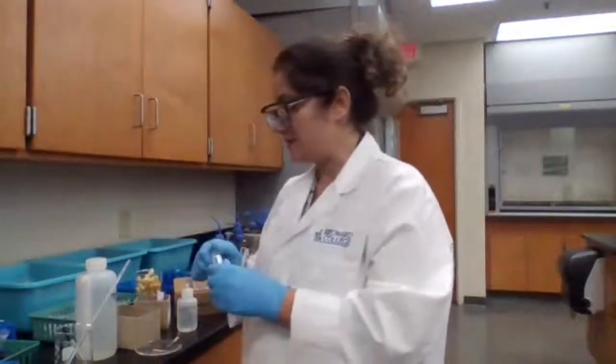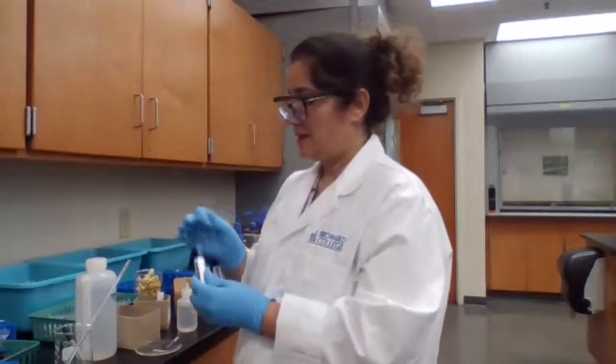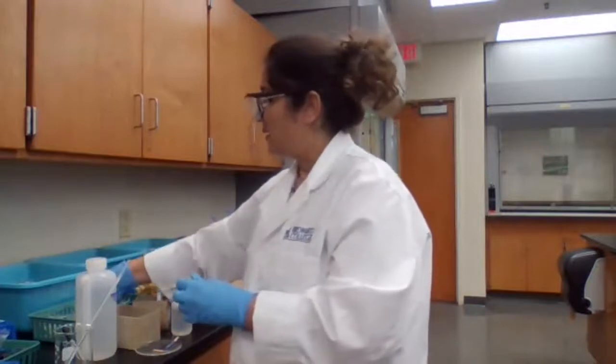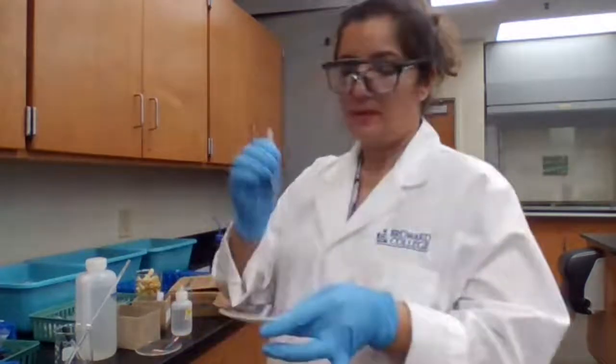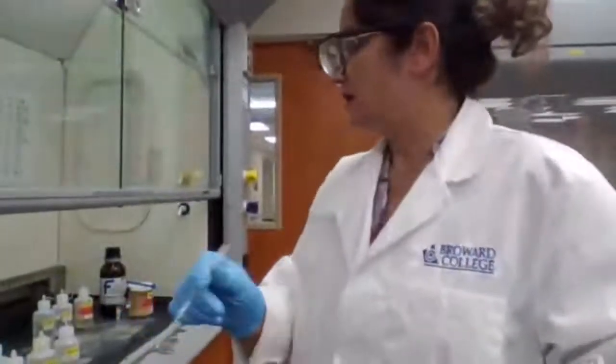If I take 1 piece of blue litmus paper and place it in a watch glass, I'm going to add acetic acid, mix it well, and add a drop to the litmus paper, and I show you the color because it's a blue litmus paper now. When it's acidic, when we add a drop, it would change from blue to pink.